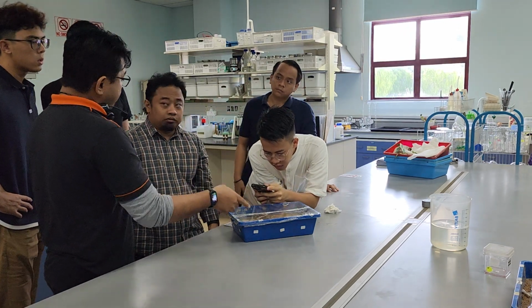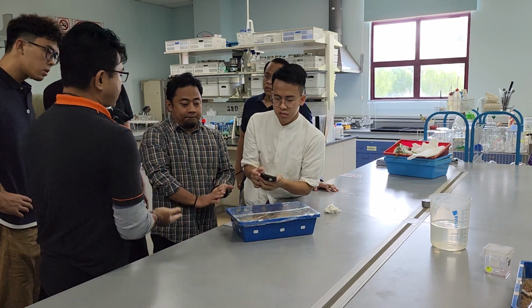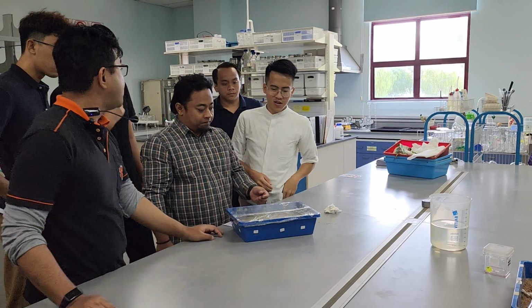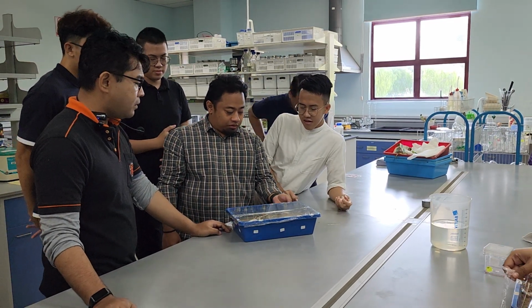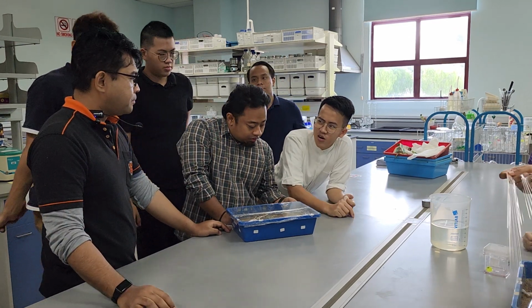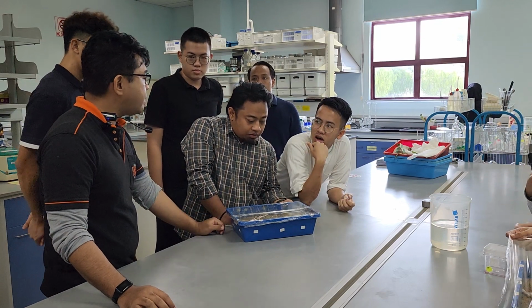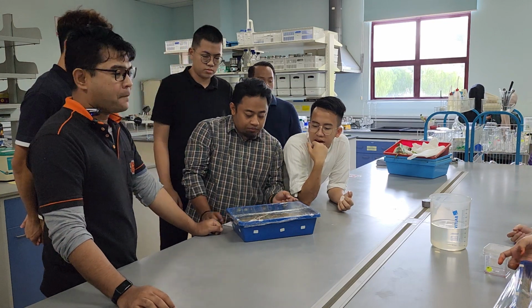Before you leave, another trick to make this grow faster, leave some moisture on it. Take some water, splash on it. On this. So it becomes cooler. Kalau dia cooler, dia akan jadi cepat lagi cepat. Tapi if it's not treated dengan fungicide, nanti dia fungus. Since this got fungicide, you don't have to worry about that.